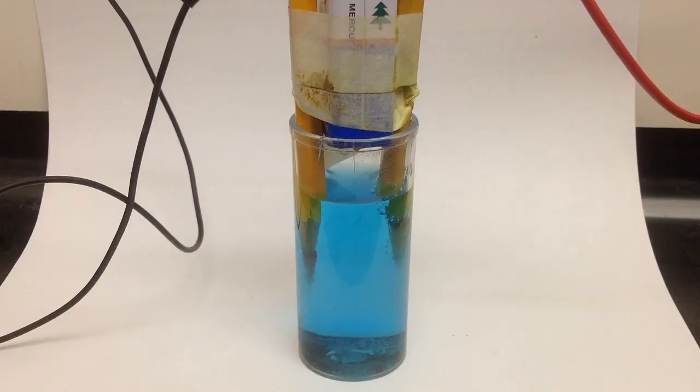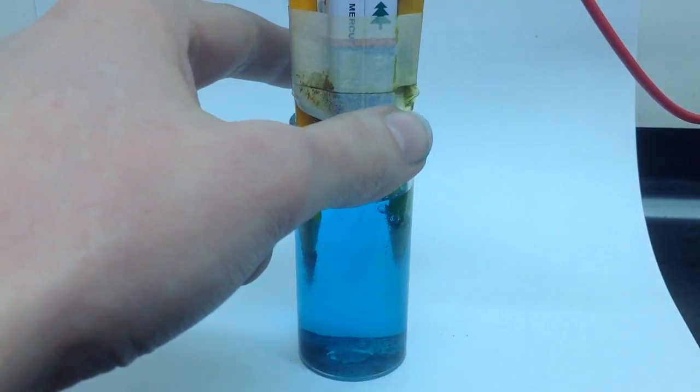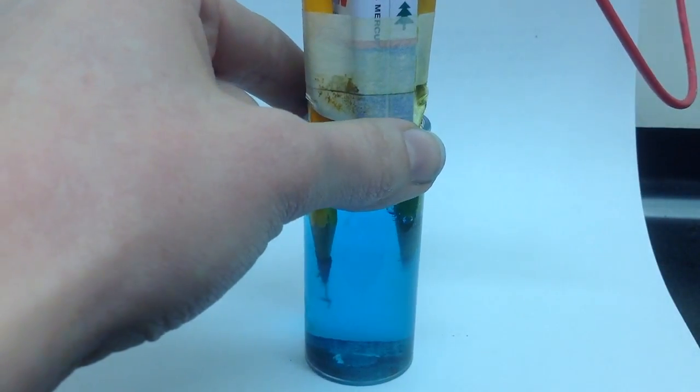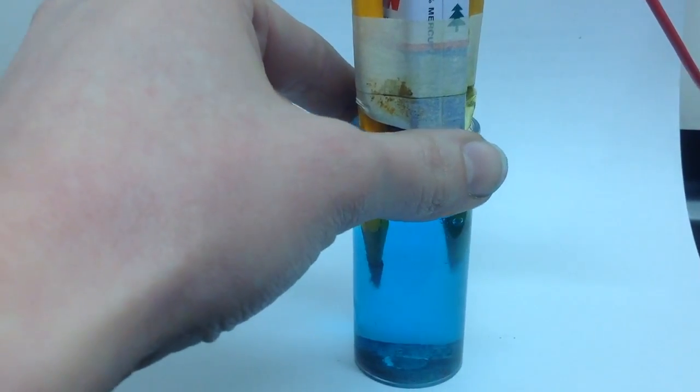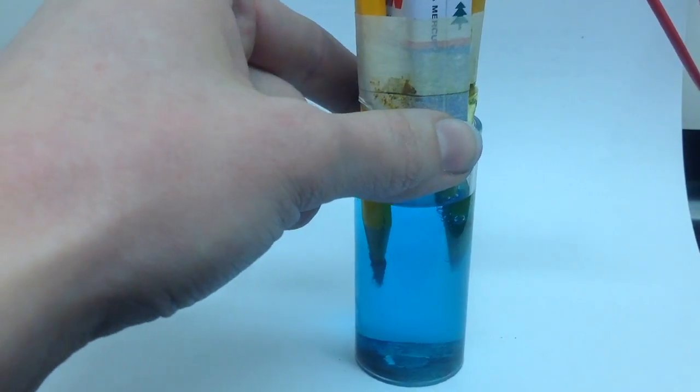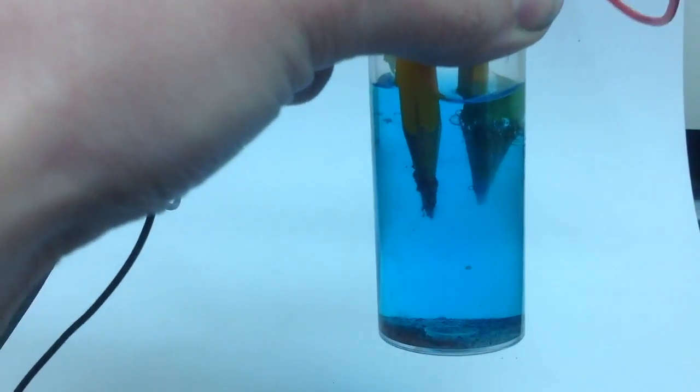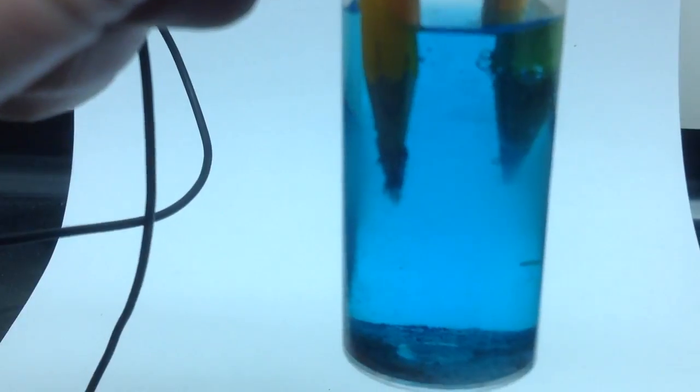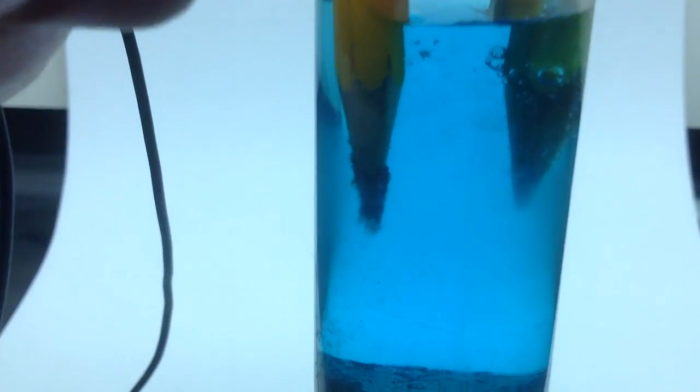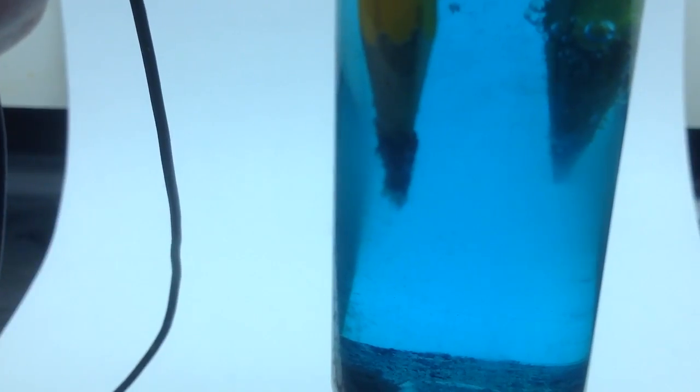I've let this reaction go for about three to five minutes since the last time I showed it to you. So, let's go ahead and see what's happening now. On this side, we can kind of see that material.